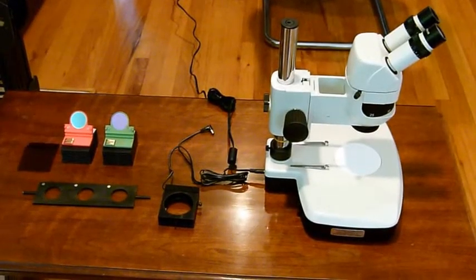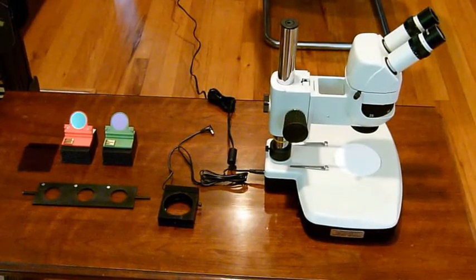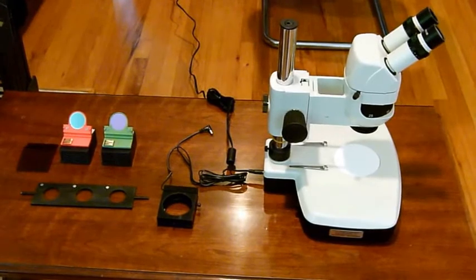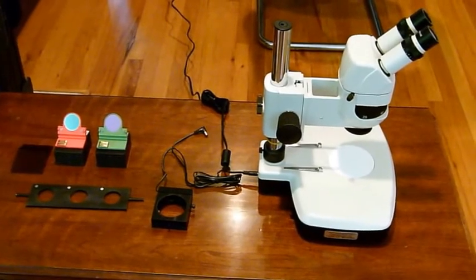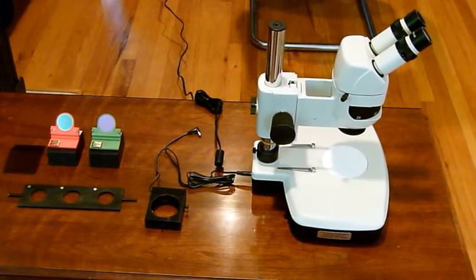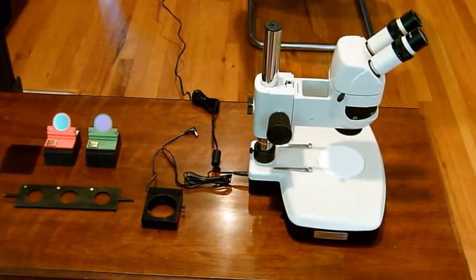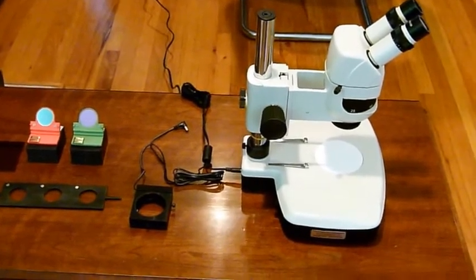Hi, this is a quick video on how to assemble and use your Tritec Research SMT1FL Quick Change Fluorescence Dissecting Scope.